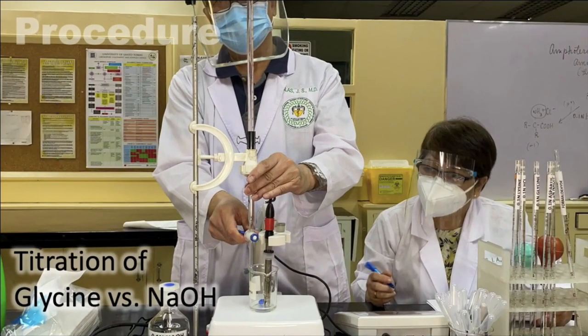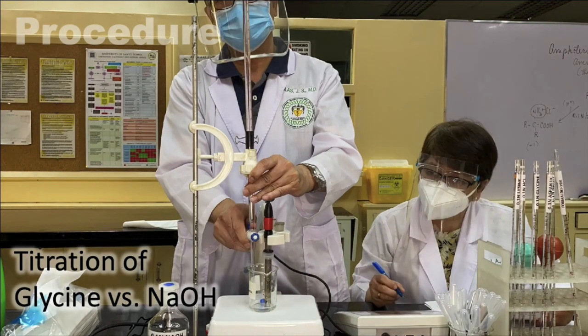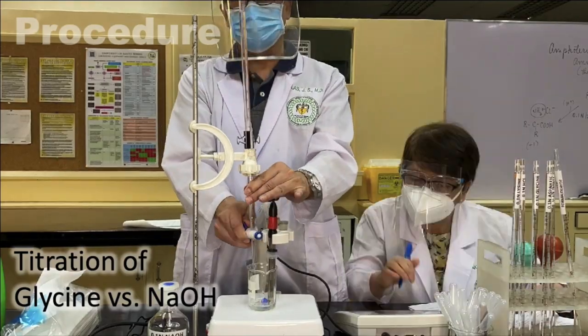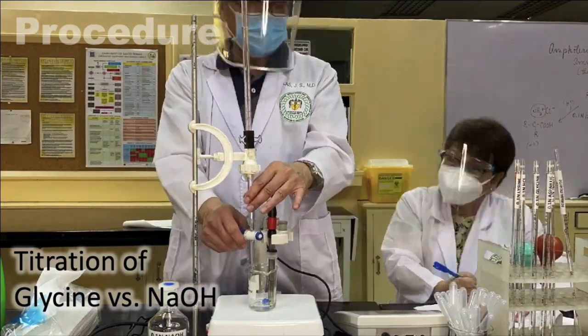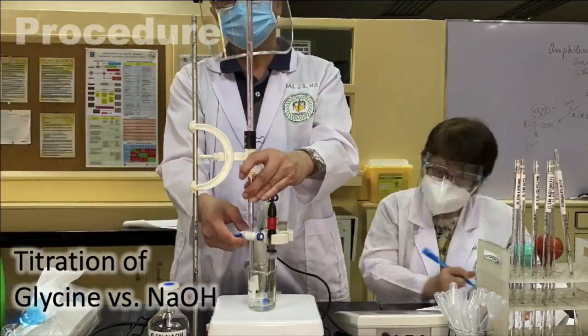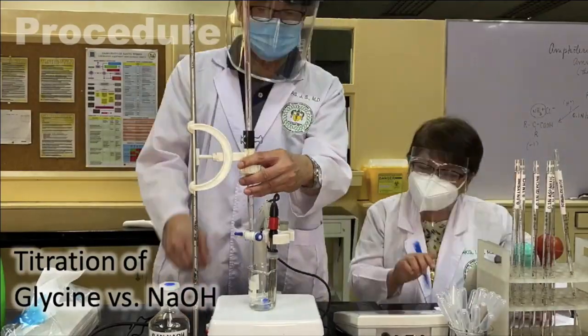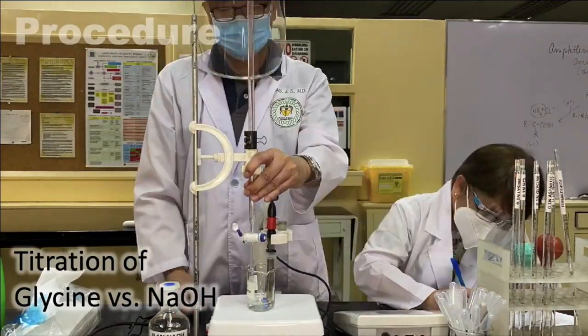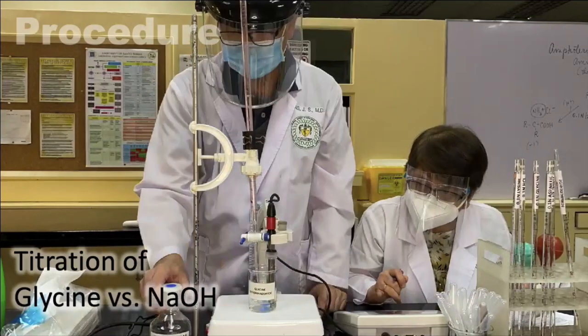We will repeat the process of titrating glycine but against the base, sodium hydroxide this time. We will go through the same process using 0.1 normal sodium hydroxide until 20 ml is reached.